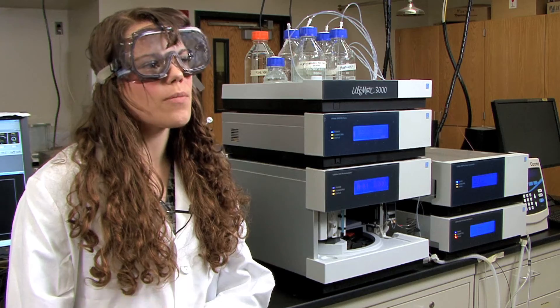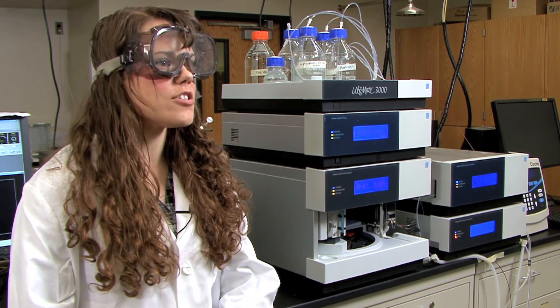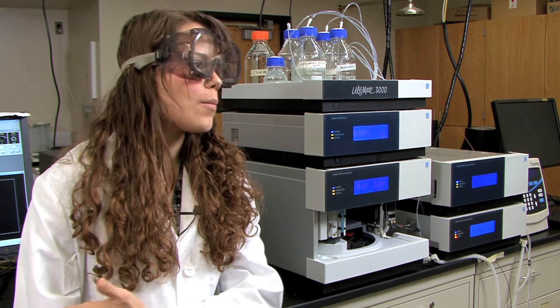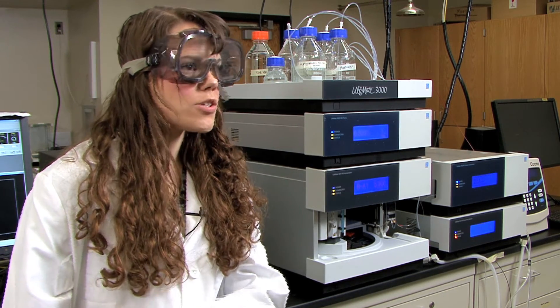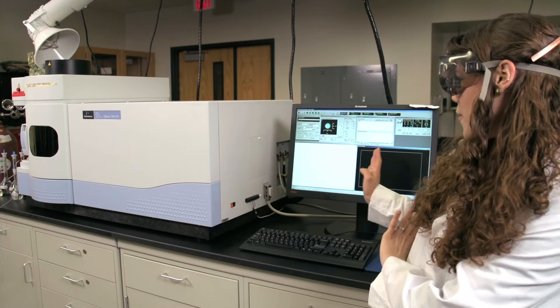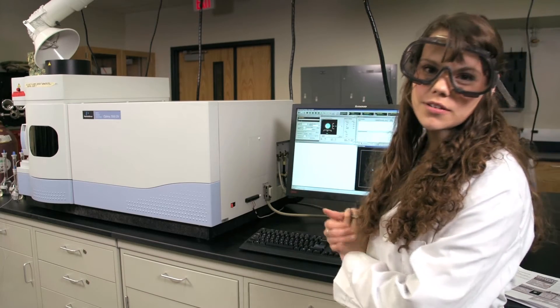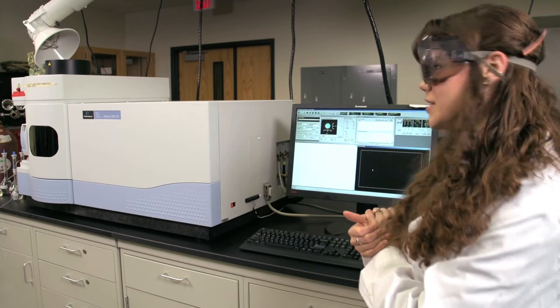When you get to the lab, the instrument will already have been turned on by the TAs or the lab manager and will be warmed up. The screen will already be open with the windows that you will be using today.